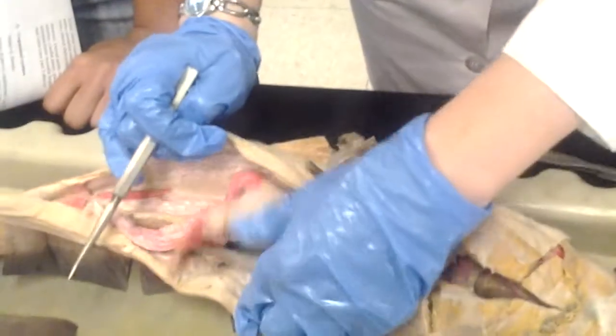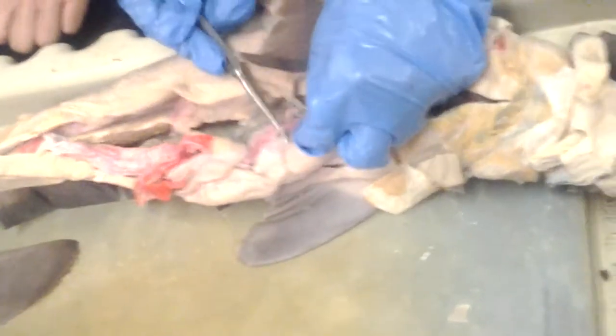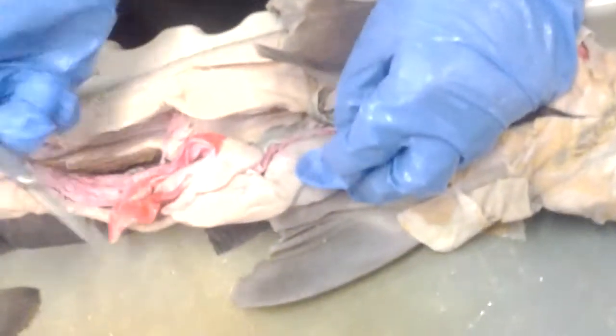Can you just go over the celiac and dividing up, and then the one next to the celiac that was really a ligament? Alright, so this is the celiac artery. It goes to the gastric artery, which you can see spreading all along the stomach. And then it goes somewhere else too, the hepatic.